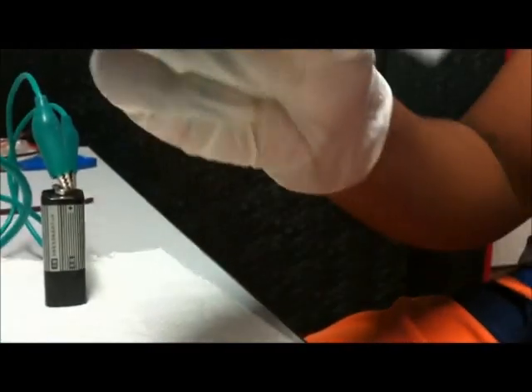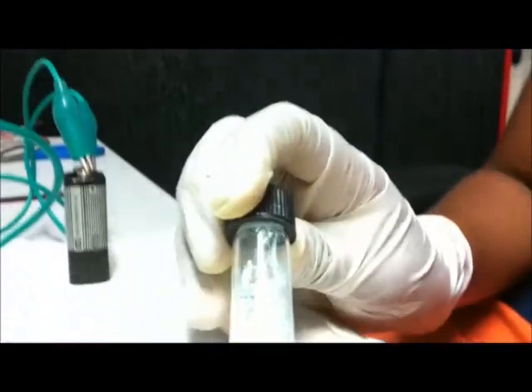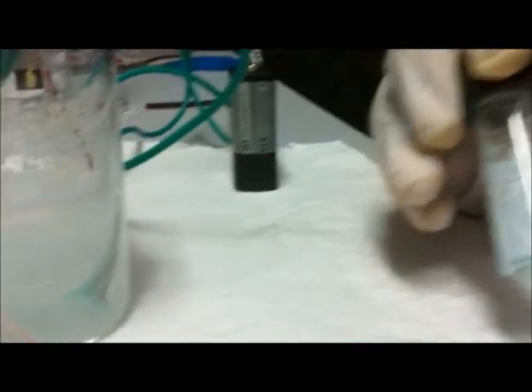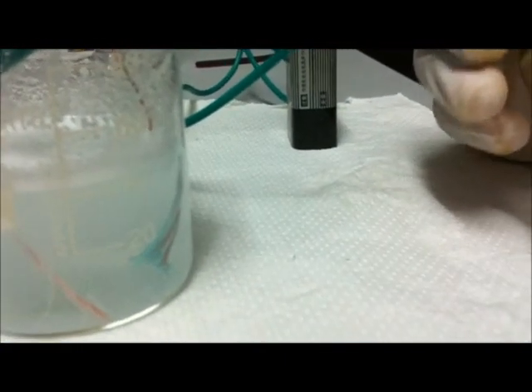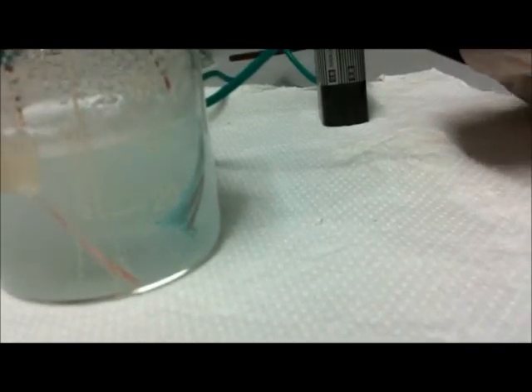If you leave this reaction to go for an hour or two, you will get a lot of copper hydroxide deposited, and then it can be filtered and stored in a vial. And here's my sample. It was just a small sample.